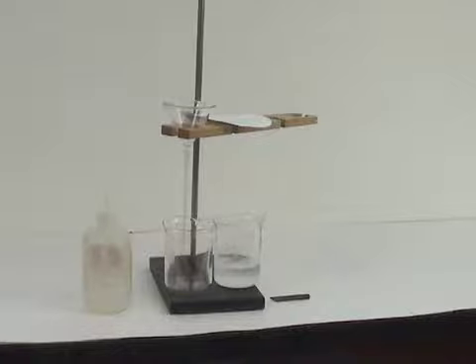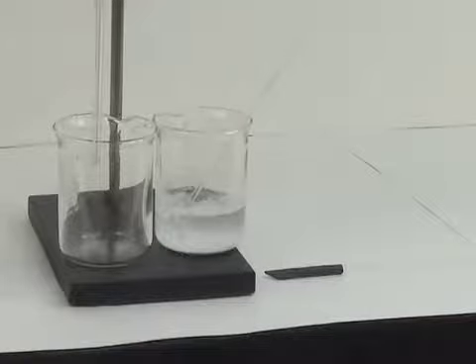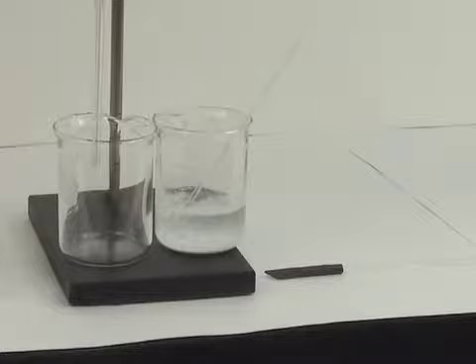Here's a picture of the apparatus you'll need to perform the filtration. You'll see the long stem funnel, filter paper, wash bottle, a waste beaker, and of course the precipitate to be filtered. You'll also see on the right hand side a glass rod with a rubber policeman on it.